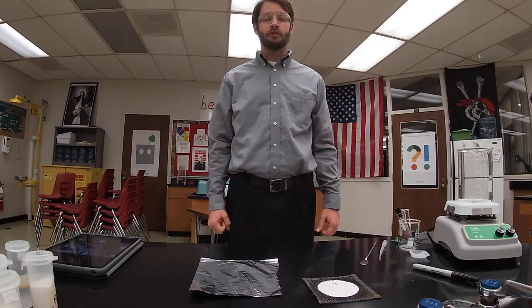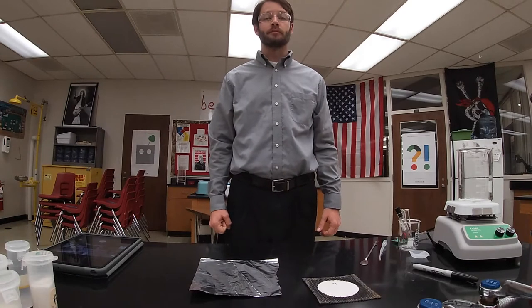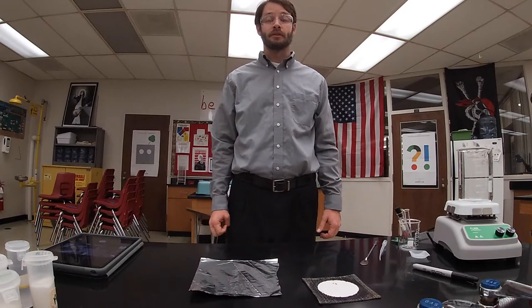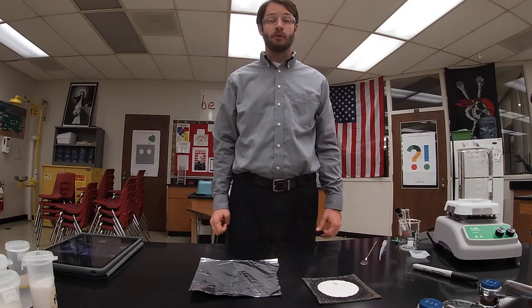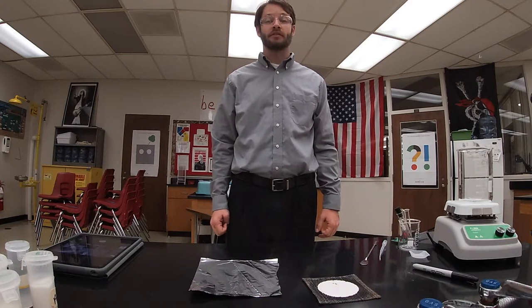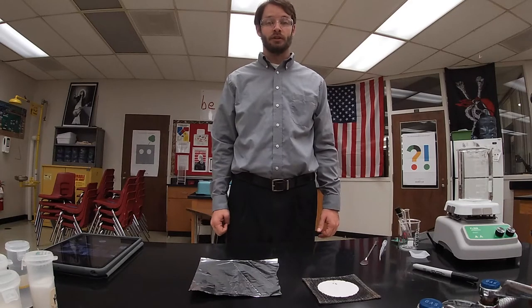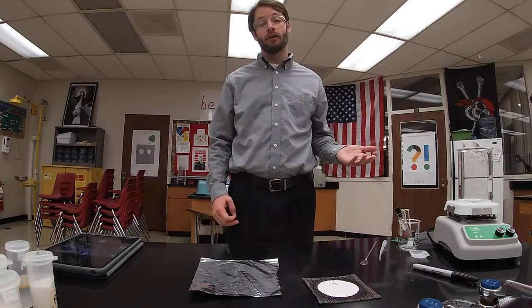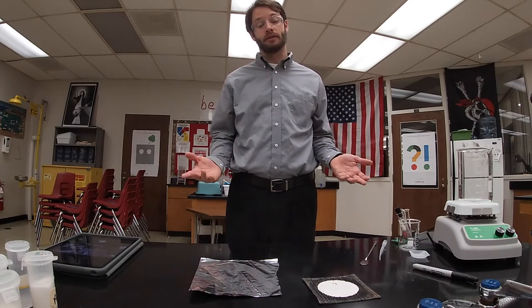For this lab, we're going to observe the physical properties of nine different substances so that we can determine the type of bonding that exists in each. They're either going to be ionic or covalent.